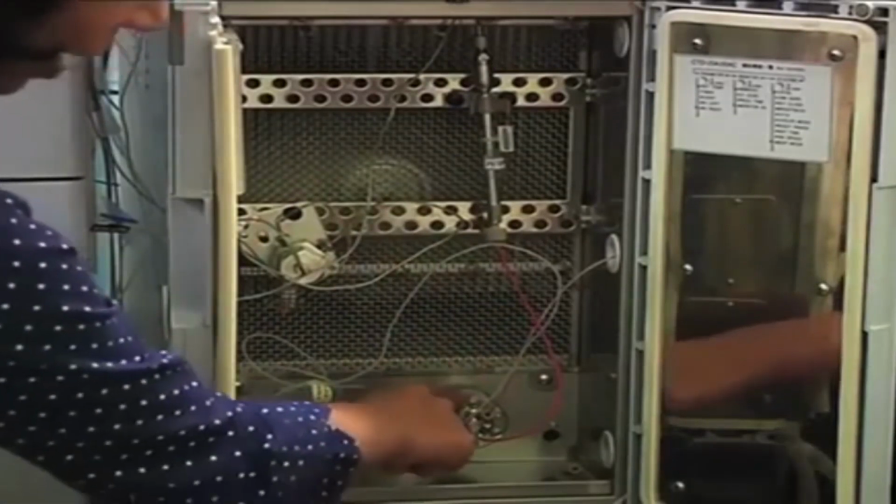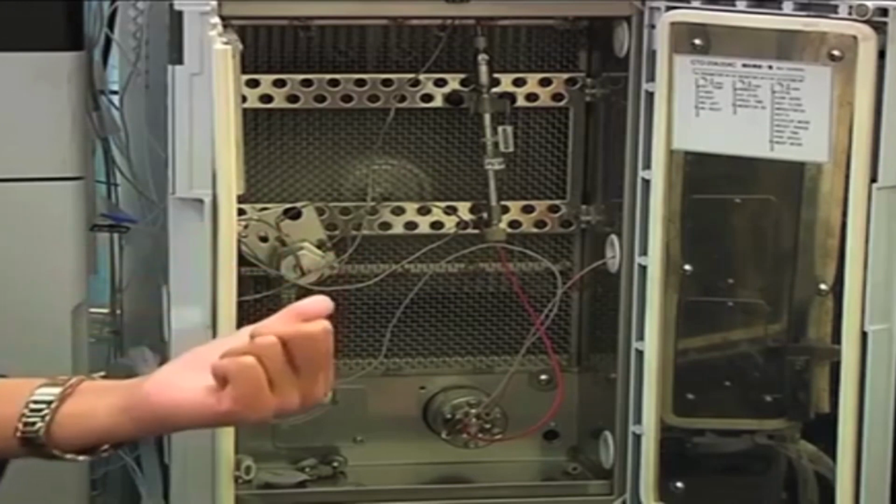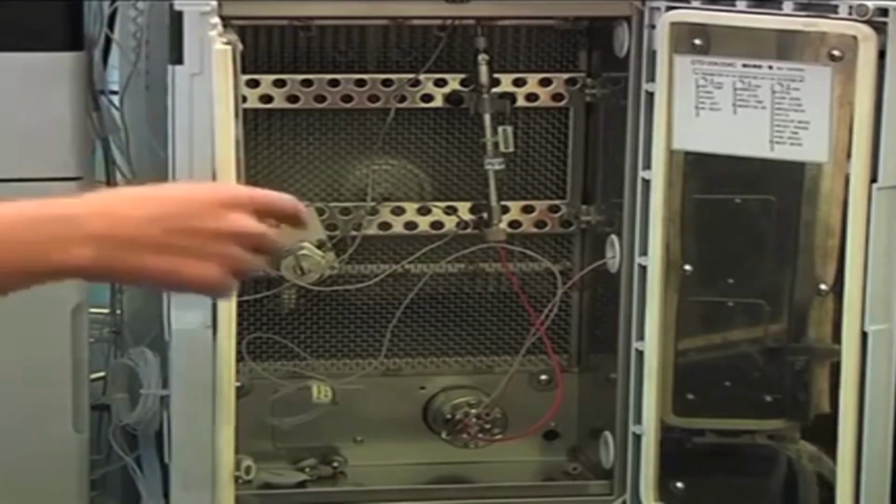Okay. This part is called the flow control valve, FCV. What is the use of this part? If you want to minimize the contamination of the MS, you can use the FCV. For example, I know that up to 10 minutes, all my peptide peaks are coming out of the column, and for the remaining 5 minutes or more, whatever is coming is unwanted material from the tissue lysate, which I don't want to send to the mass spec because it might contaminate my mass spec. So I can give commands.